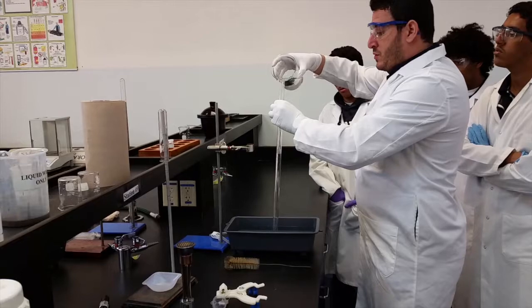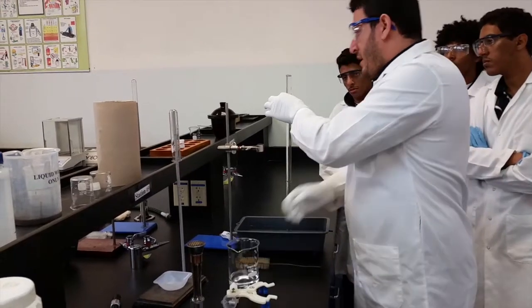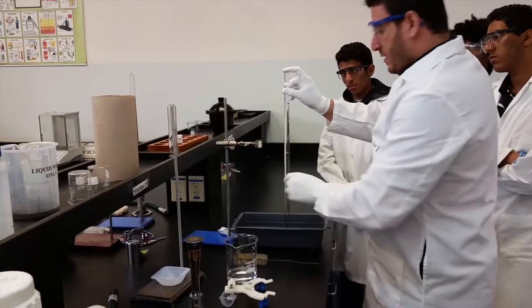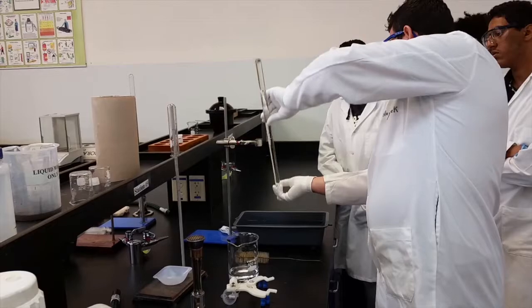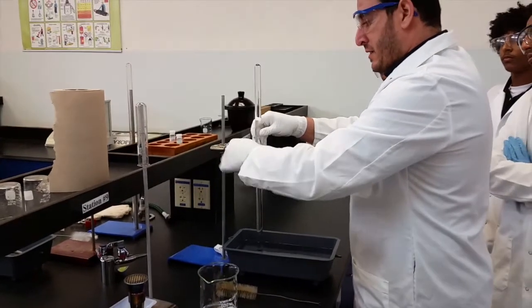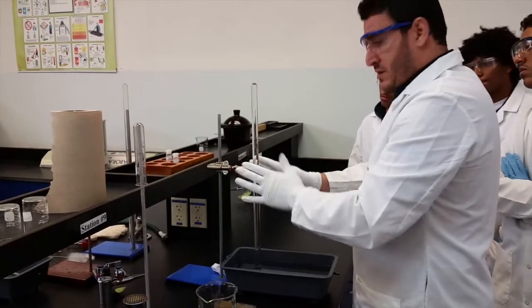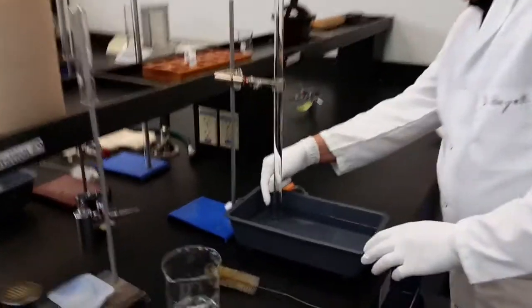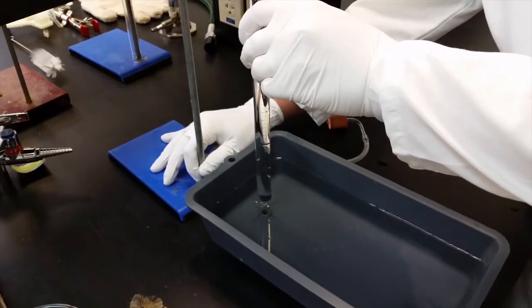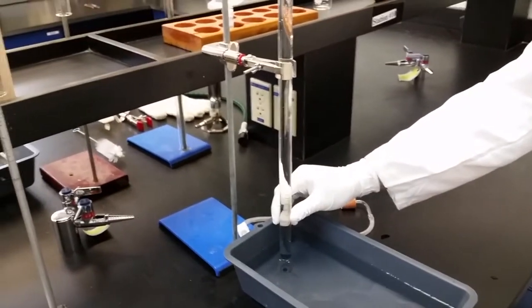The air bubbles will contribute to experimental error. Look how I filled it up — to the maximum — and then I take my finger to close it, which also lets me rotate my hand. While I keep the mouth of the tube inside the water, I can just place it. It just needs to hold. As you can see, it's not positioned to the hole, so I will move everything with the stand and position my tube, centering it to the hole.